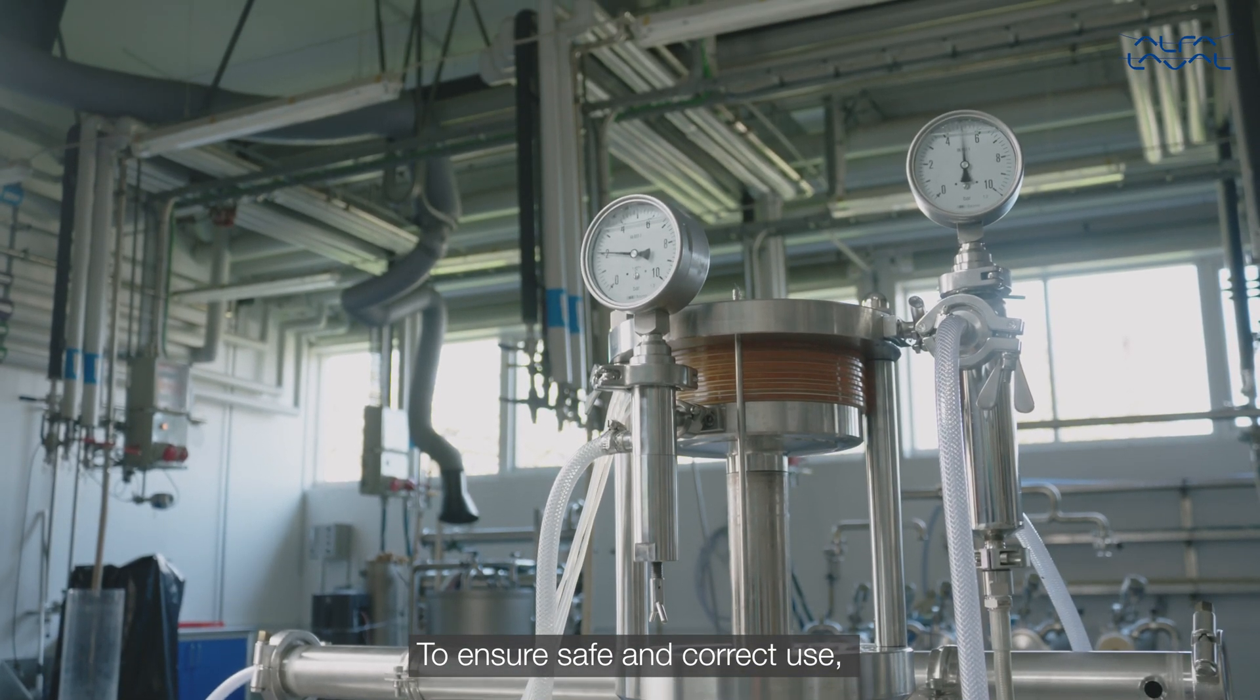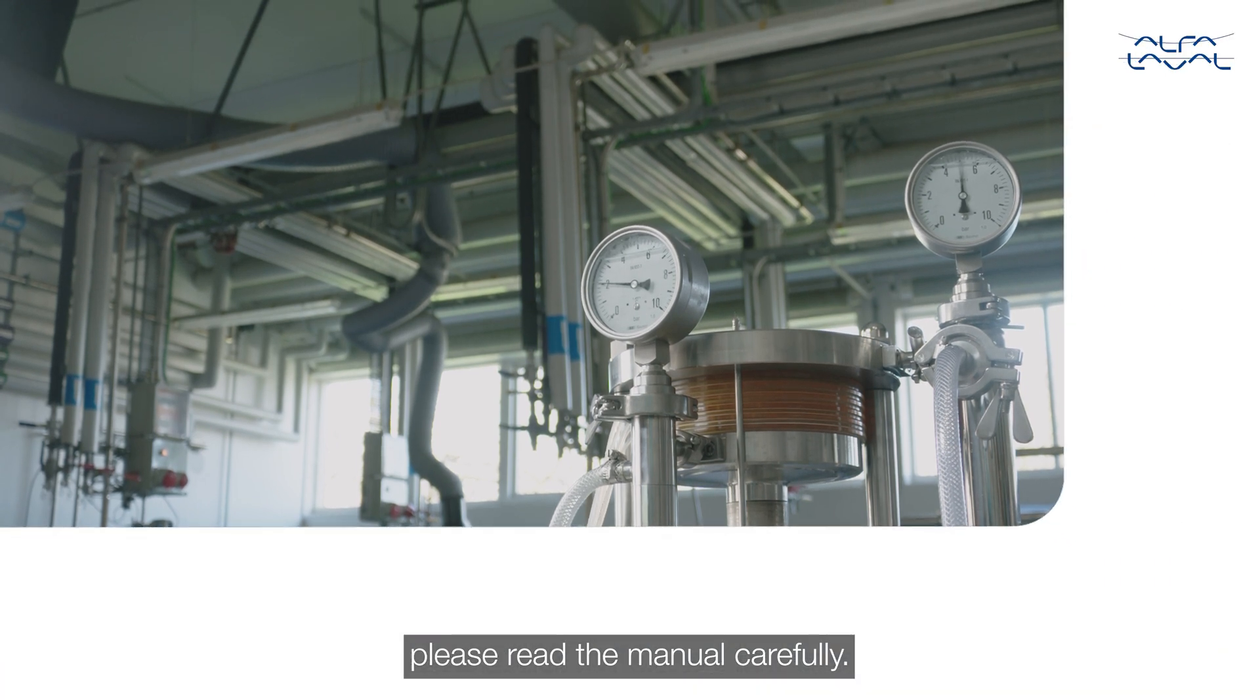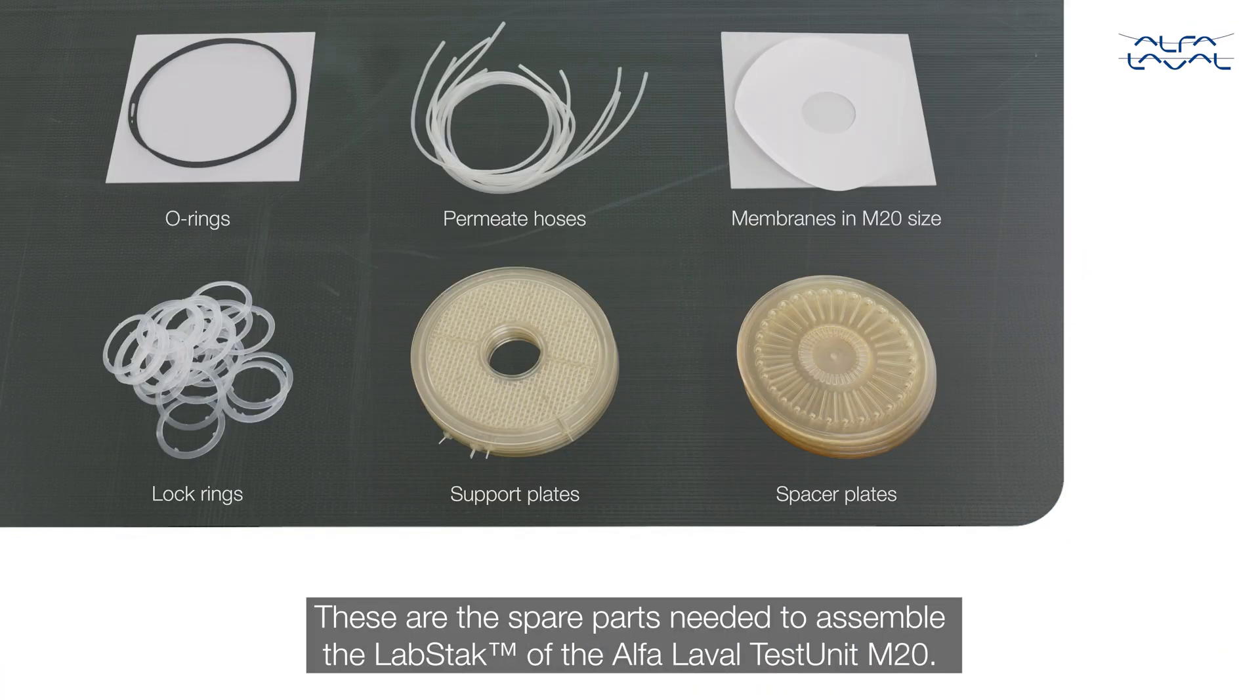To ensure safe and correct use, please read the manual carefully. These are the spare parts needed to assemble the lab stack of the Alfa Laval test unit M20.